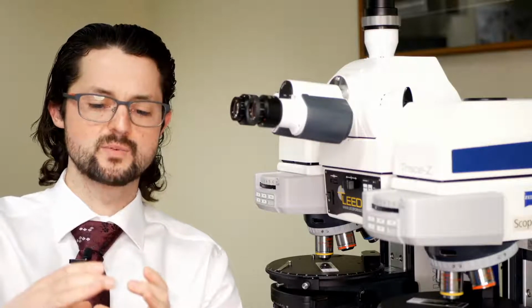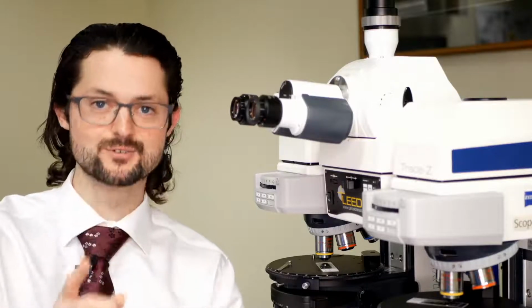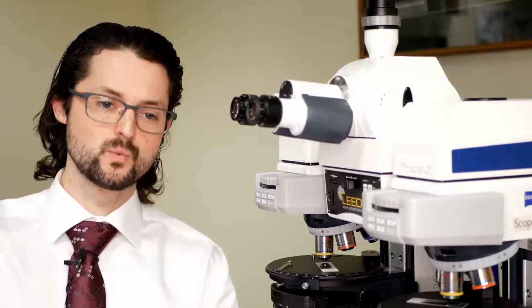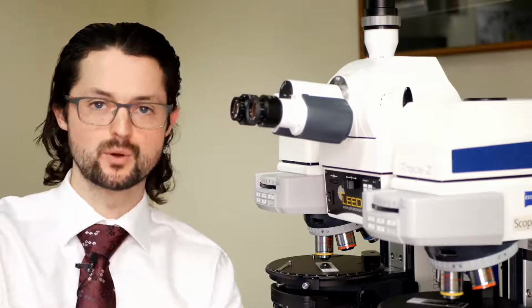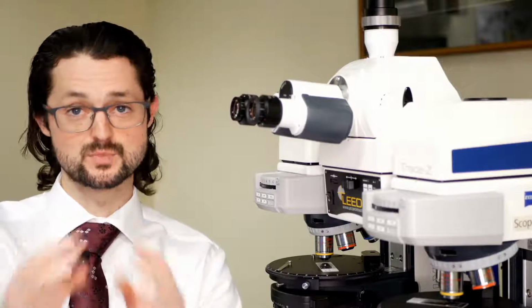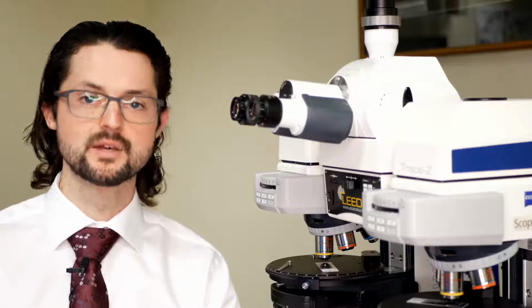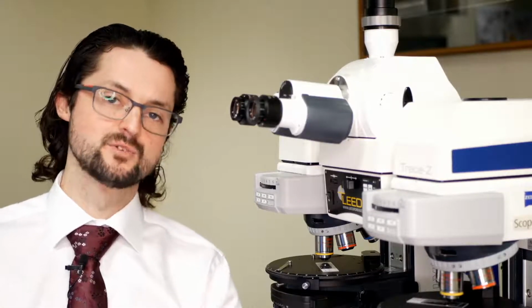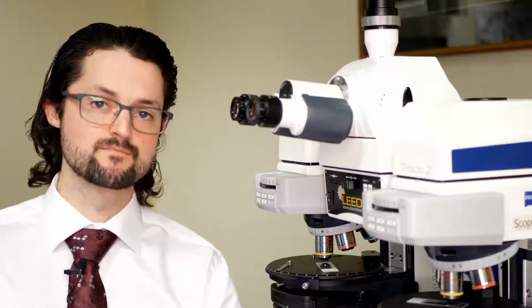So one of the things we have to be careful with when building a comparison scope that uses this single light source is that, because of all the energy coming out of the light source, we need to do some filtering to block the UV component and the infrared component so it doesn't just burn out our polarizers. So there are other things that we do there too. But the end result is that it's a fairly easy upgrade. It allows you a whole different technique, a whole different way to look at your samples.